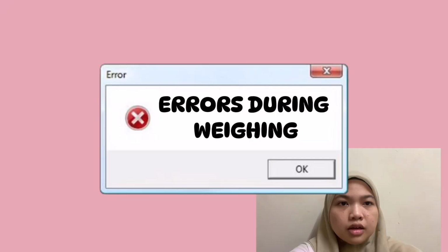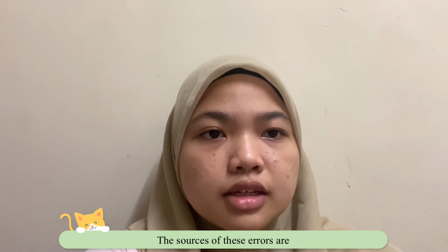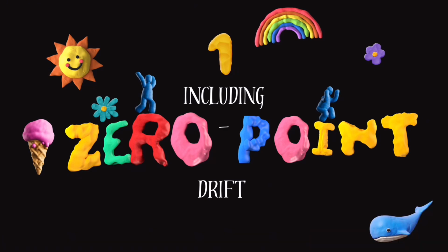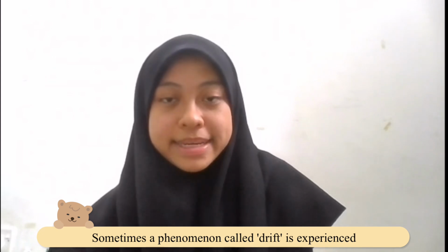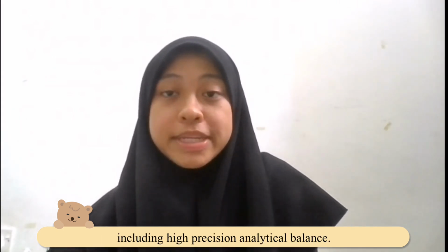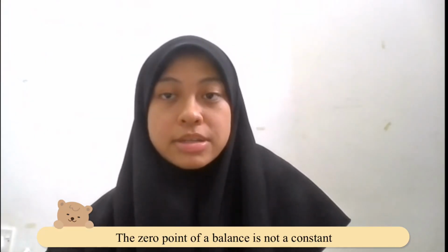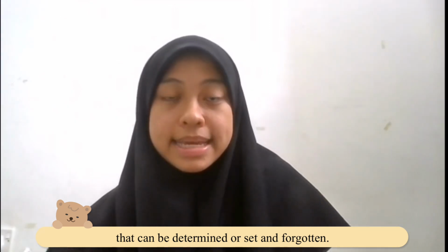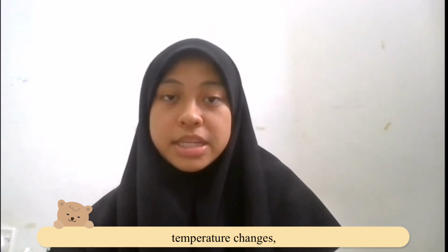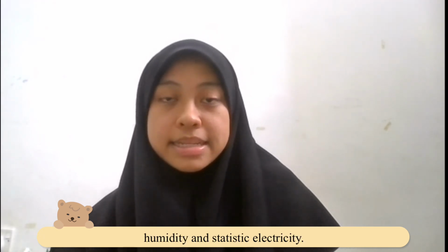That's all. Errors can happen when weighing. The sources of these errors include the 0-point drift and the change of ambient temperature. 0-point drift: sometimes a phenomenon called drift is experienced in weighing instruments, including high precision analytical balances. The 0 point of a balance is not a constant that can be determined or set and forgotten. It can drift for a number of reasons, including temperature change, humidity, and static electricity.